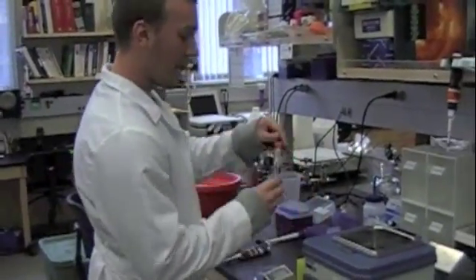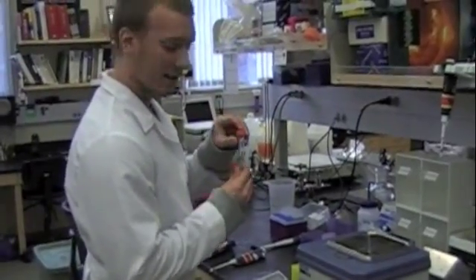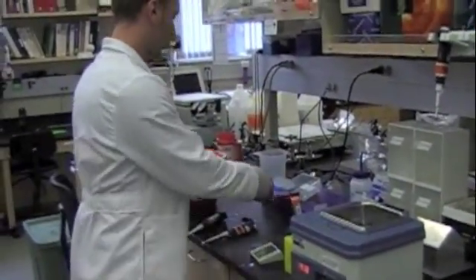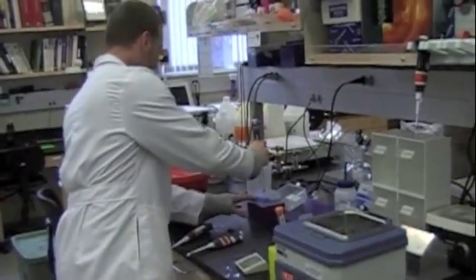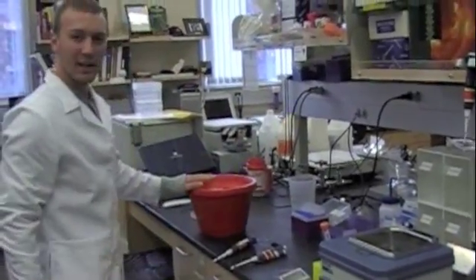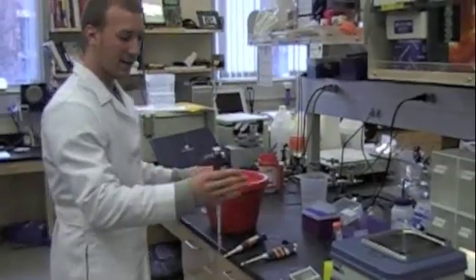Proceed to adding 250 microliters of SOC media to your cell mixture. It's important that you let your mixture incubate on ice for at least one minute before you add the SOC media.